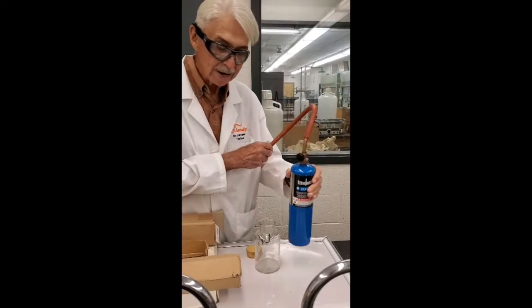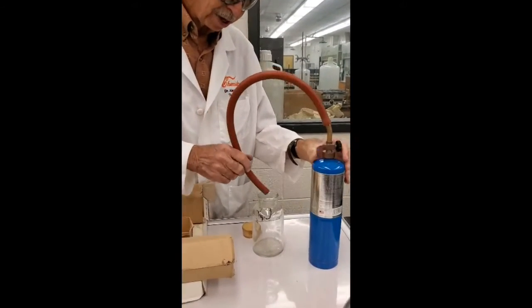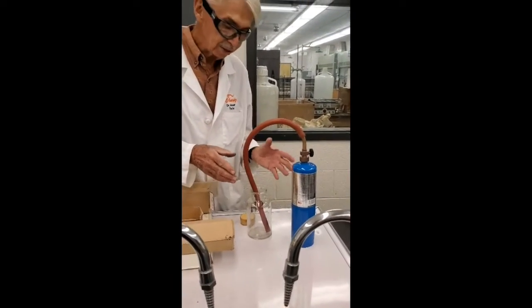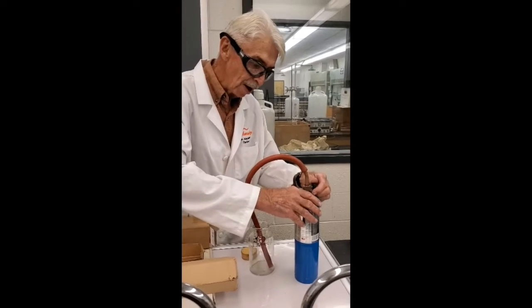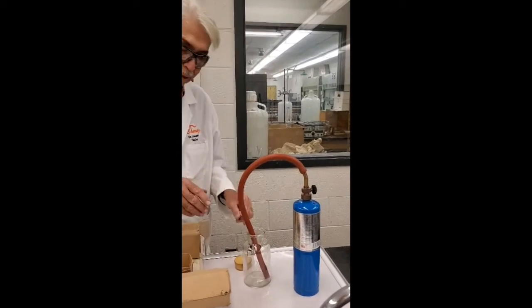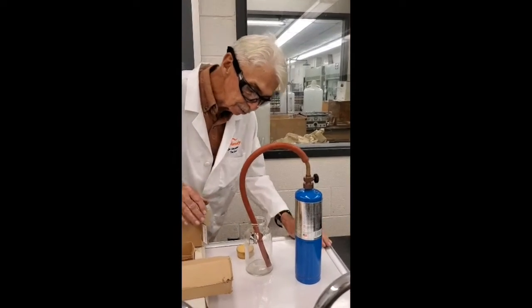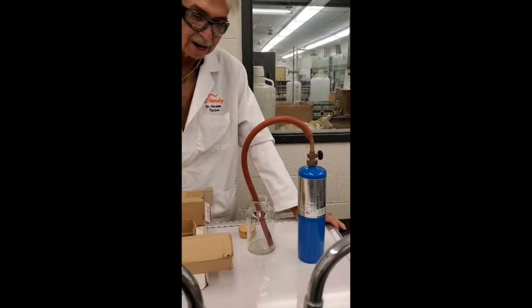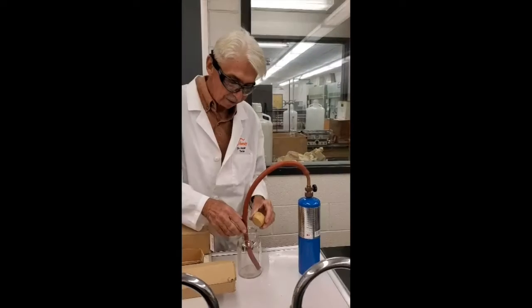Propane, there's a propane torch, and I got this here. And propane is also more dense than air. In fact, it's almost the same density as carbon dioxide. So I open this valve, it's going to come out in there, and it's going to fill up from the bottom, and I can tell when it fills because it has an odor. And I can smell it when it comes out, and smell it a little bit, it won't hurt you.